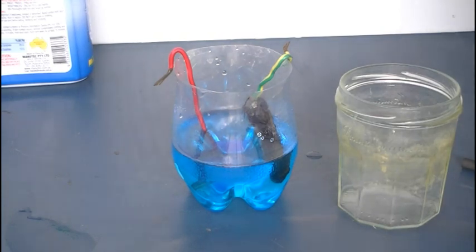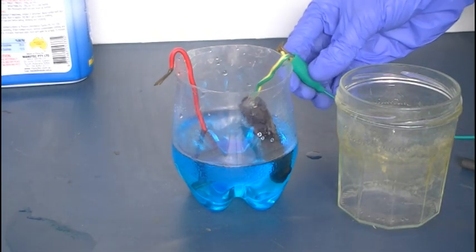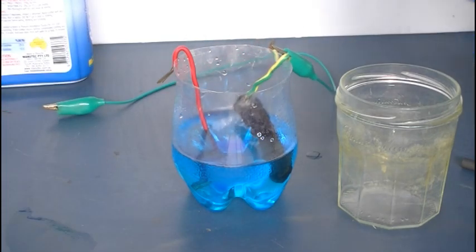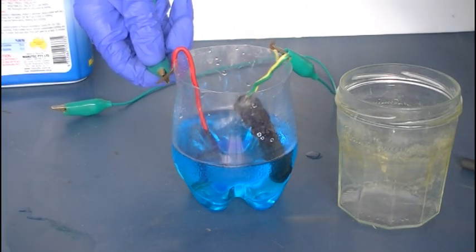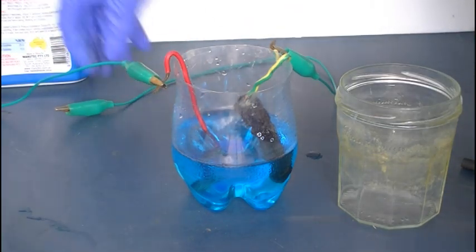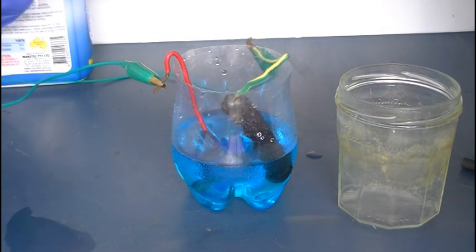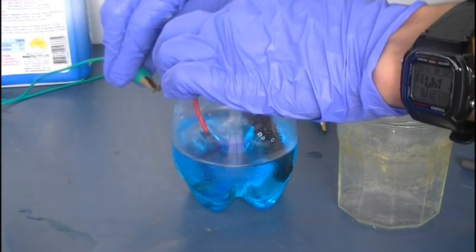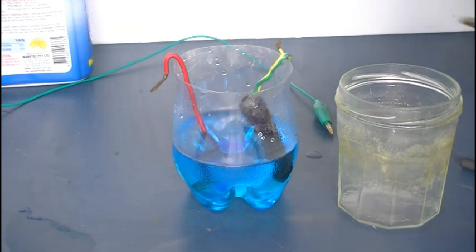Alright, let's connect it up. I've got a 12 volt power supply off-screen to the left here. We'll connect it up to 12 volts first. Negative will go to your copper electrode and positive will go to your carbon or lead dioxide anode. Actually, these wires might be a little bit too low gauge to handle the current. I might make some more.